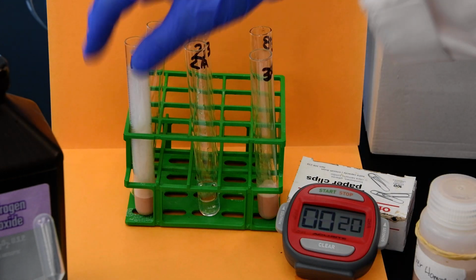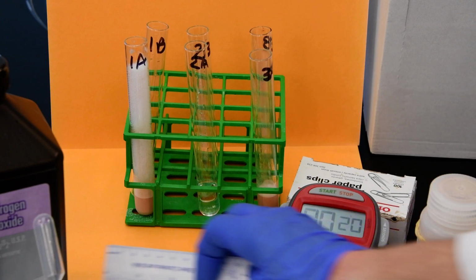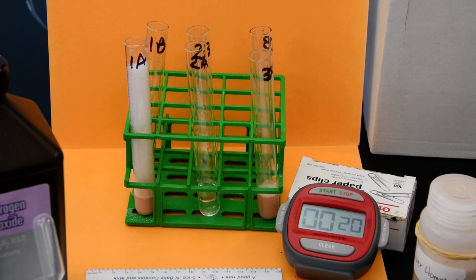All right, so again, I think you can begin to draw your conclusions about what has been demonstrated in this specific experiment. We're going to go on and perform 3 other ones and try to, again, get you to understand a little bit more about enzymes.